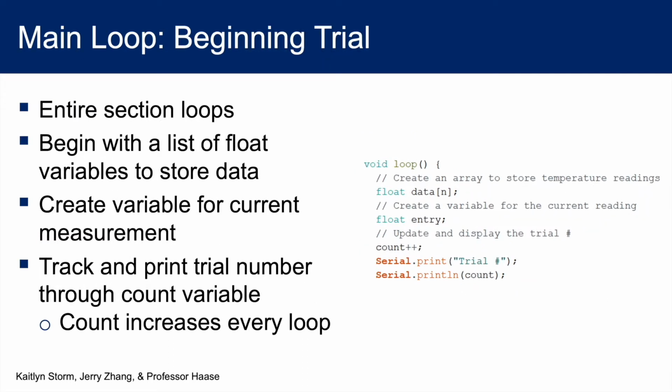In the main loop, any code we put here will continue to run repeatedly. As a quick overview, we will create an array, or a list, of float variables to store the temperature measurements. We will also have a variable for the current measurement. Between trials, we will increase the value of the count variable and print out the count number as a trial number.